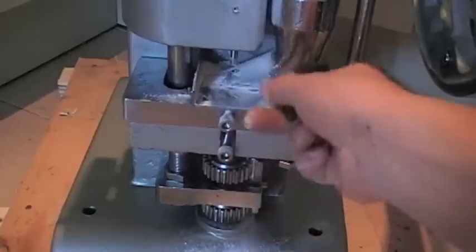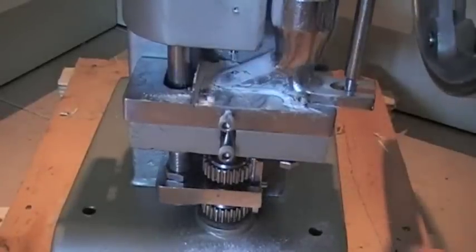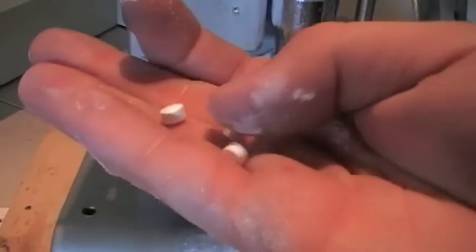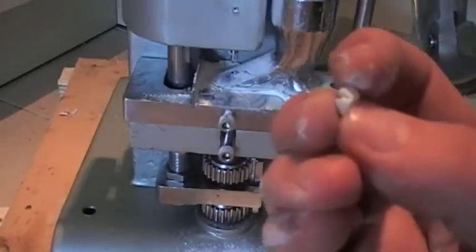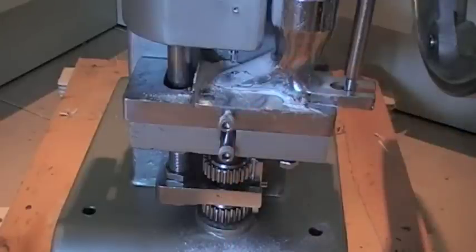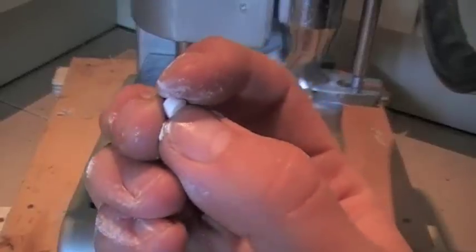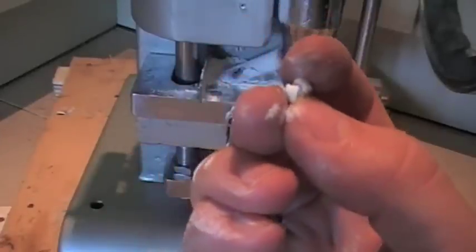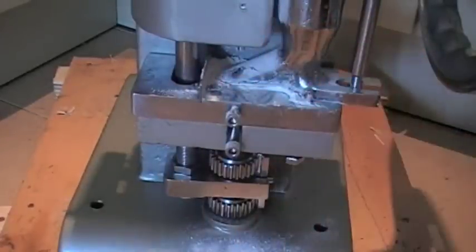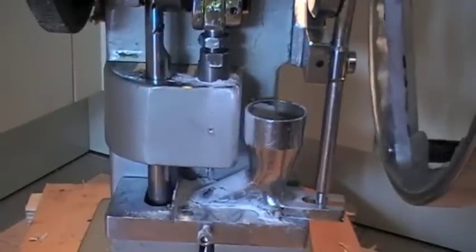If I just clean off some of the excess white powder — sometimes it's good to have a painter's brush to do this with. We're getting three tablets out. The next thing I need to do is decide whether my punch strength is strong enough. If I take a look at this tablet, it doesn't take a lot to pop it open. It is relatively strong, but it goes quite easily. I think if you were to have a thousand of these inside a bag, they'd go quite quickly. So the next thing we're going to do is adjust the punch strength.